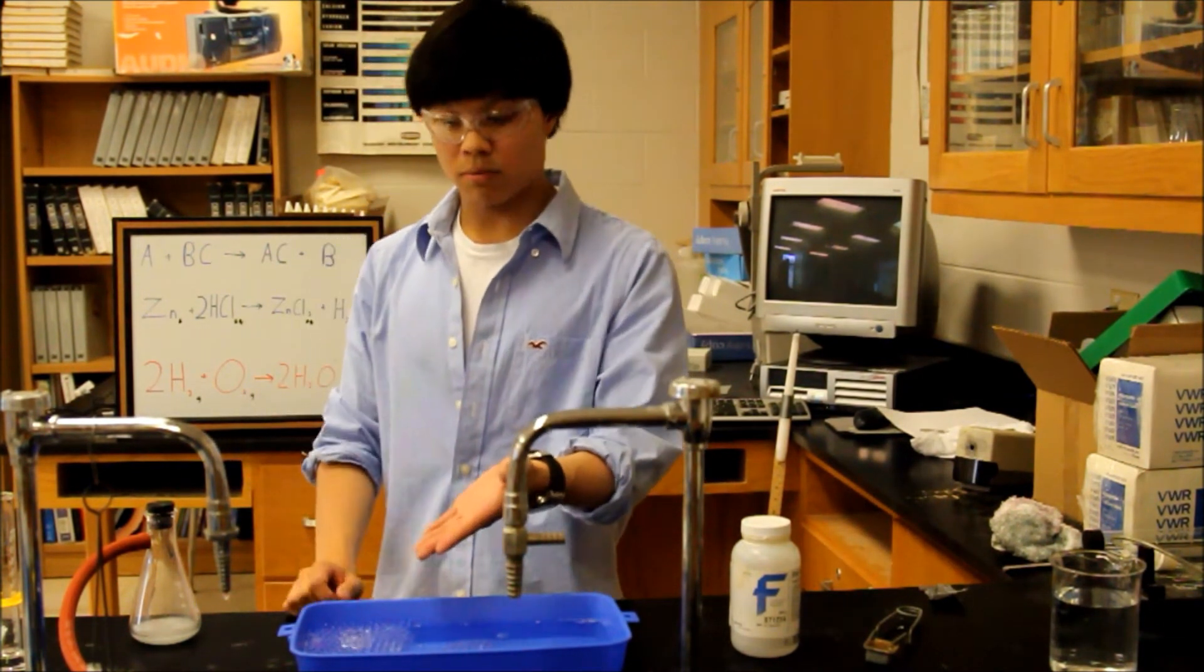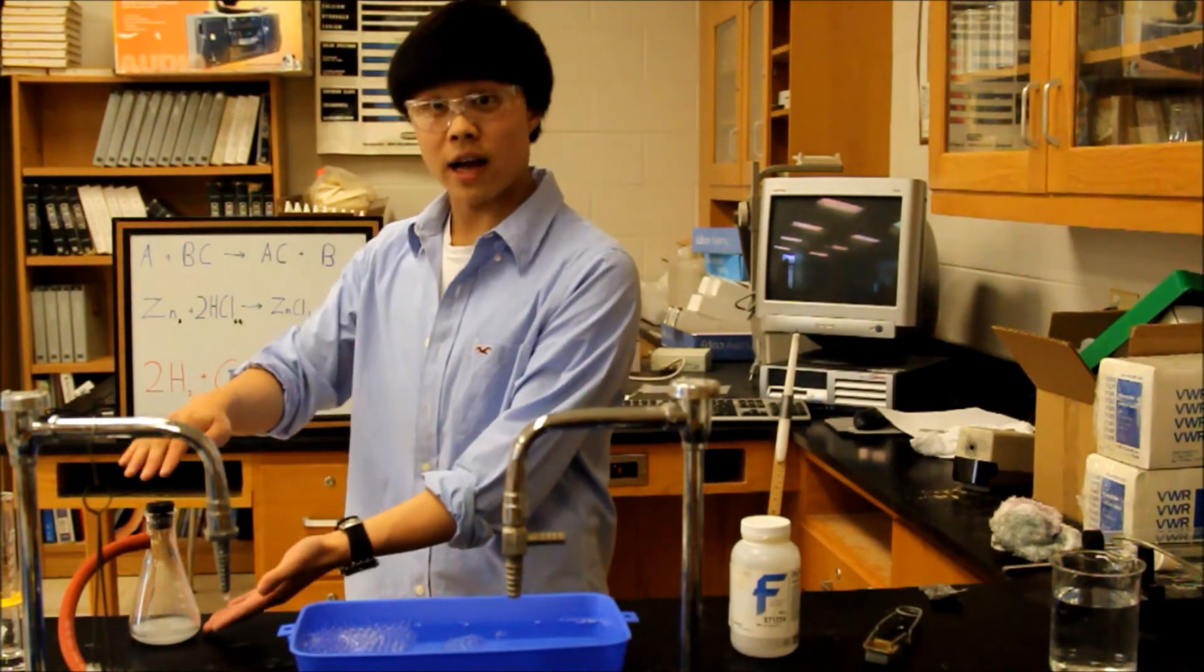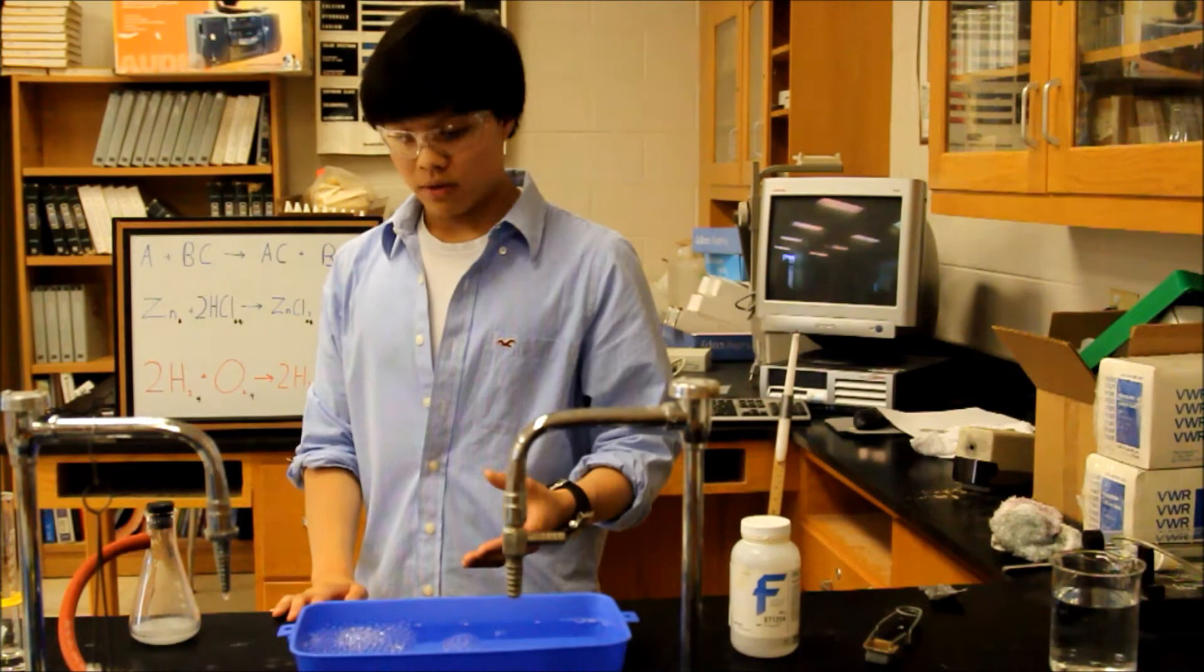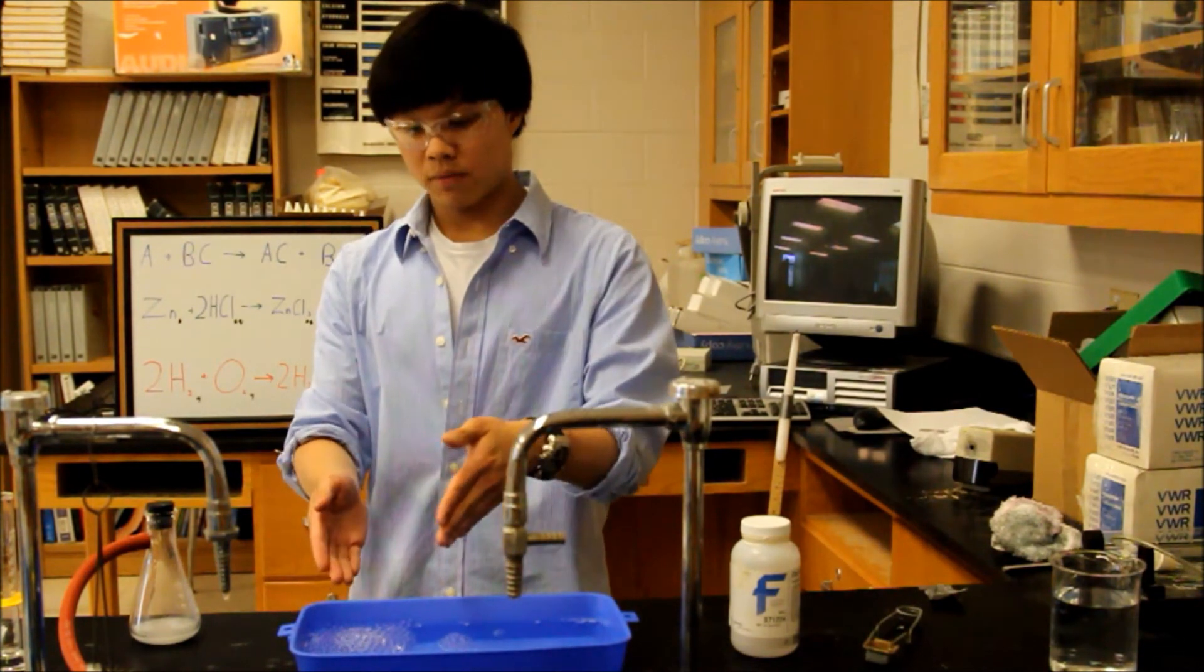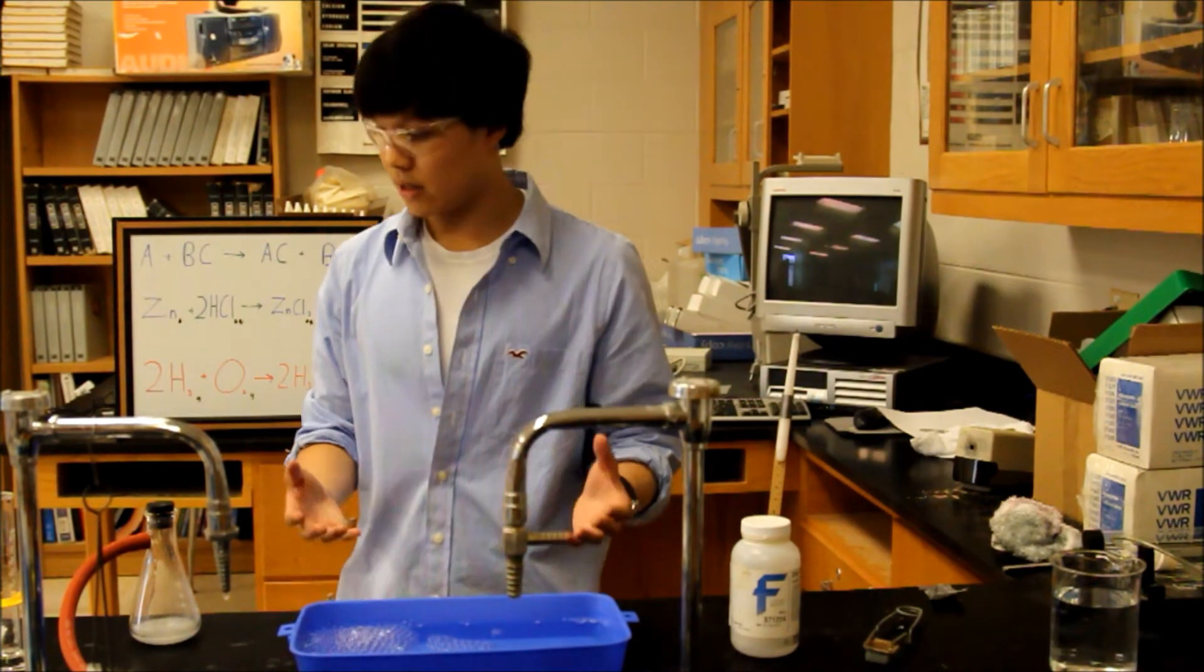These bubbles over here are pure hydrogen as they are collected from this flask. We're going to light these bubbles on fire as soon as we collect enough of them to show the reactive properties of hydrogen and heat.